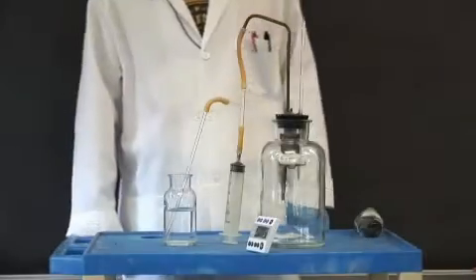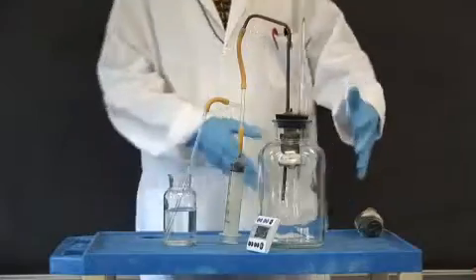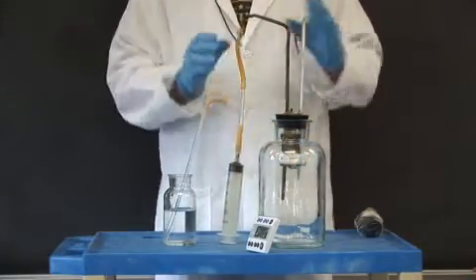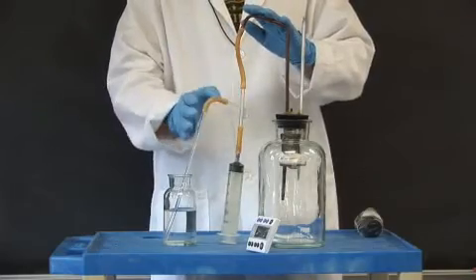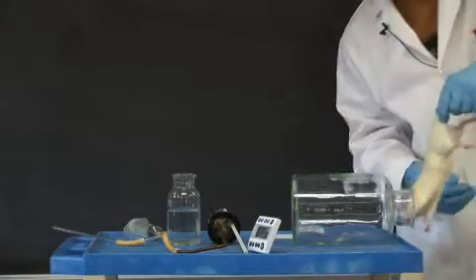All right, so to measure the basal metabolic rate of the rat in the classic way, we have our chamber, which is this device right here, sealed and connected to an improvised manometer. We will put our rat into the chamber.